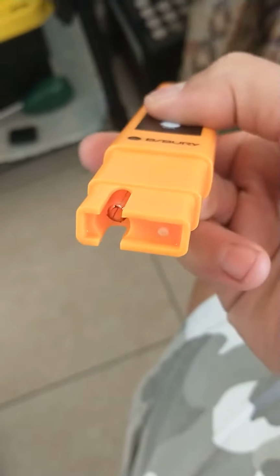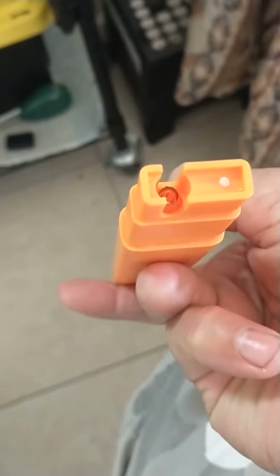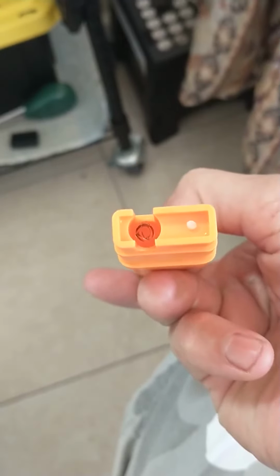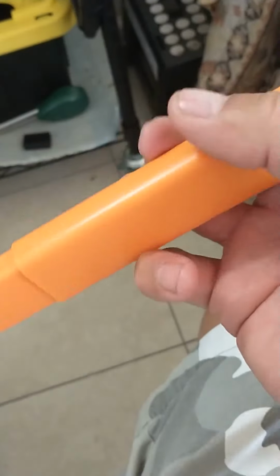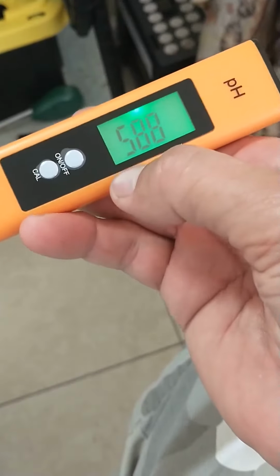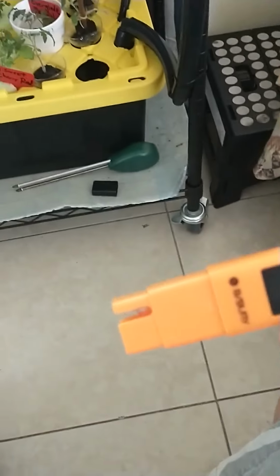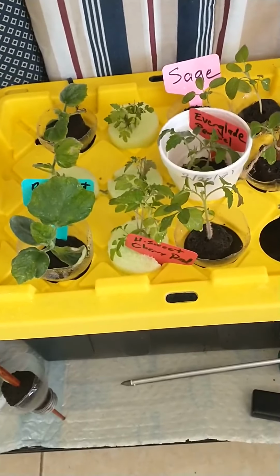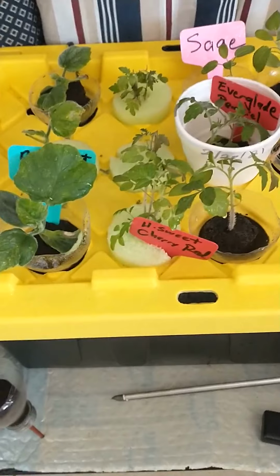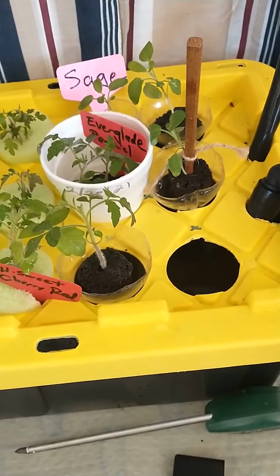Can somebody tell me why it won't stay at zero? I'm a little bit concerned. Should I trust another one of these? Doesn't look like it's damaged or anything, but it just won't stay at zero. I've been trying to calibrate the pH for my hydro system, and I should be seeing better results than what I'm seeing.